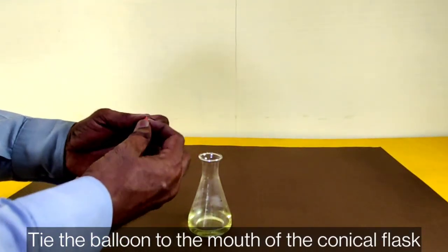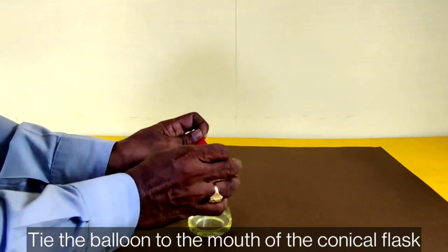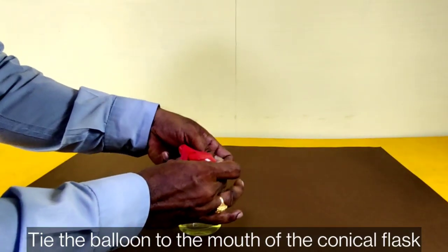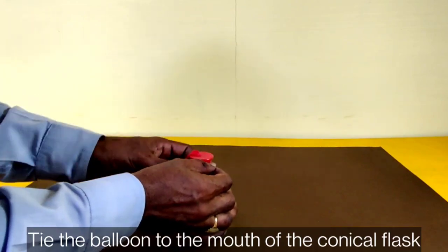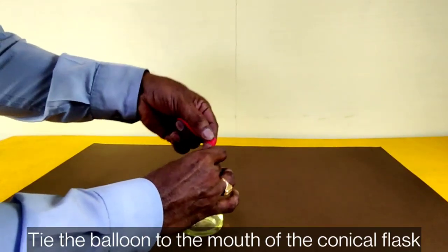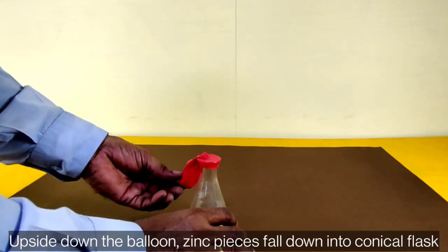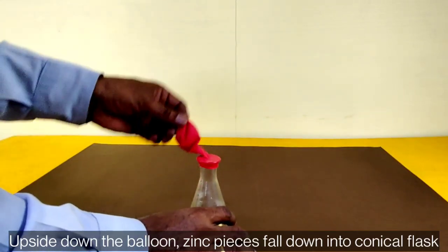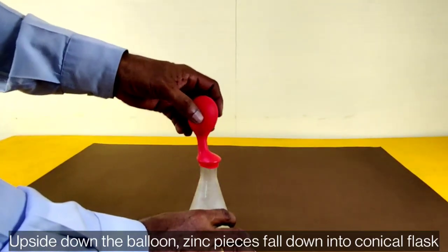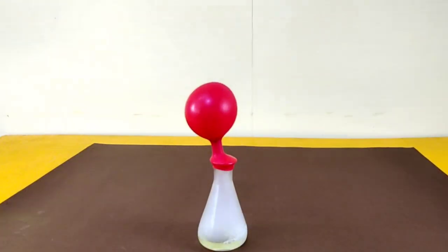Tie the balloon to the mouth of the conical flask. Then turn the balloon upside down so the zinc pieces fall down into the conical flask.